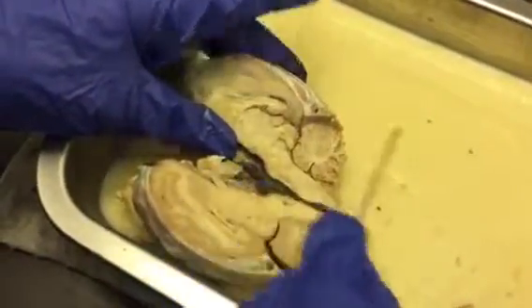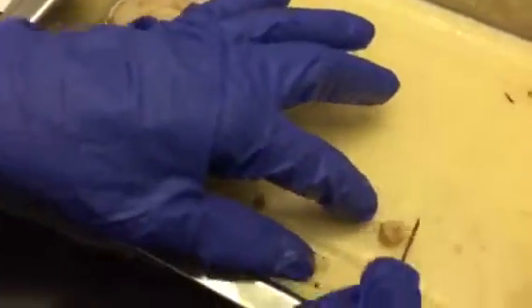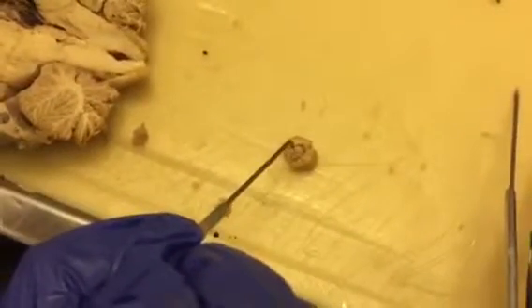And then in our spinal cord, mine's not a very good cut, but the outside would be the white matter, the inner area would be the gray matter, and if it would be facing this way, we would have the ventral roots down here and the dorsal roots up here.